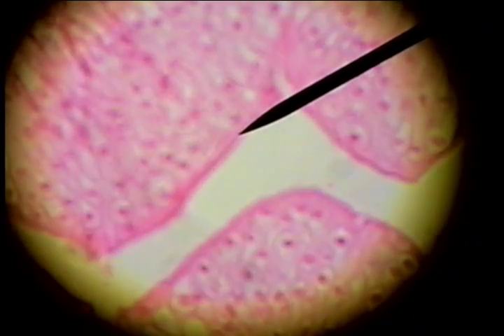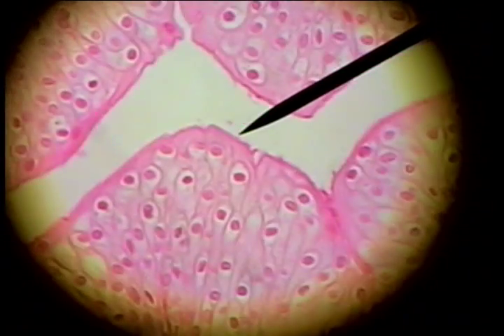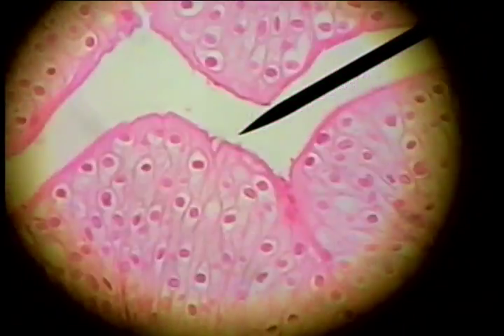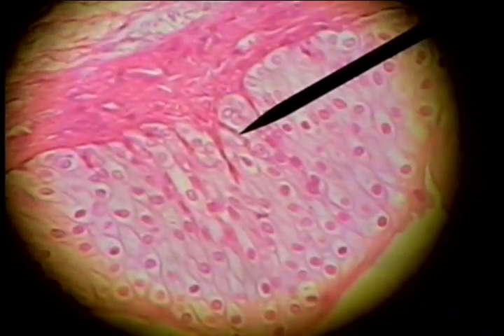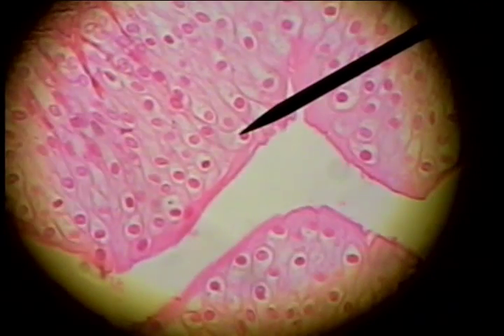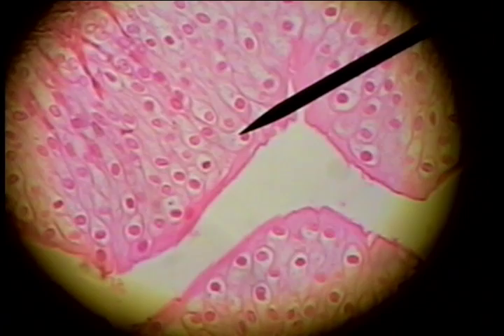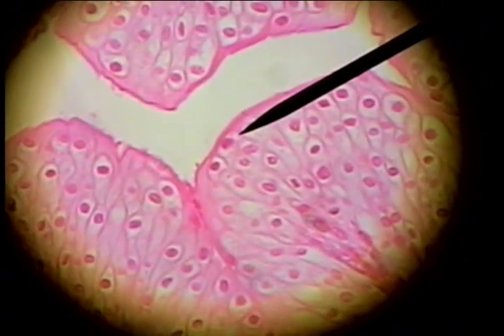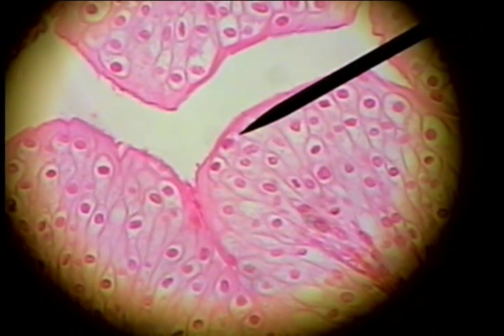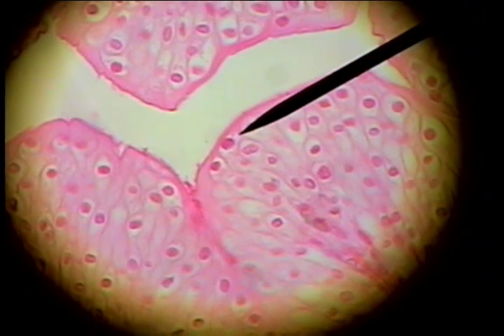If we look at the epithelium on high power, it has the very characteristic about six or eight-cell thick with the round balloon cells on the surface here, characteristic of transitional epithelium.